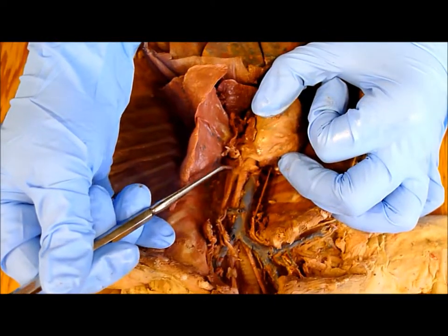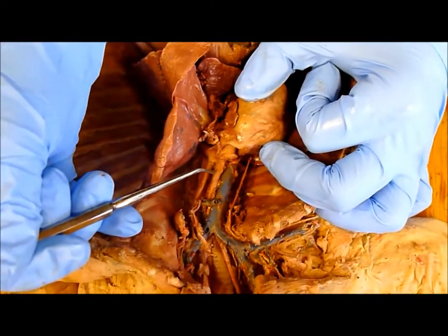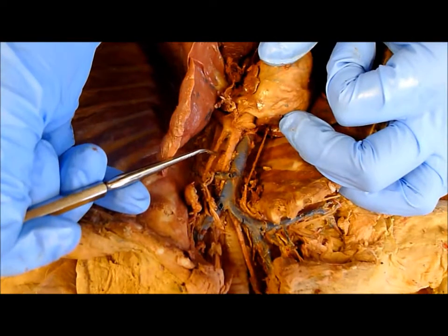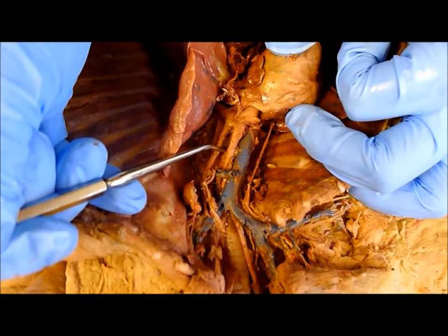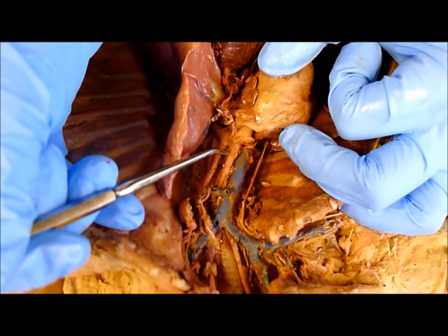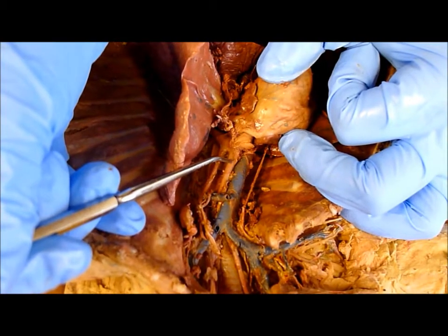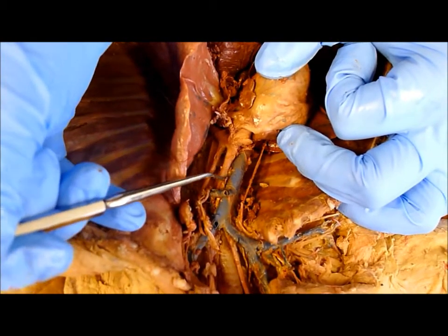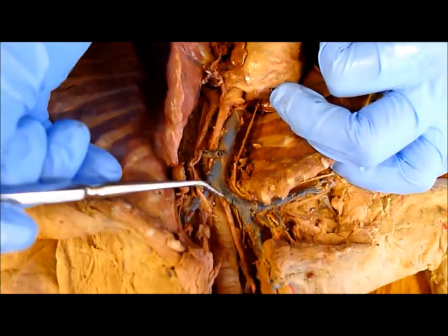Right here is the aortic arch coming out of the heart, and then there are two branches going towards the head. The middle one is the brachiocephalic trunk. The brachiocephalic trunk goes up and then right underneath here it splits off.